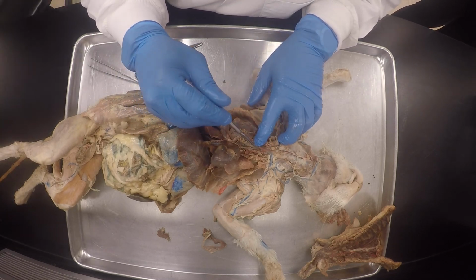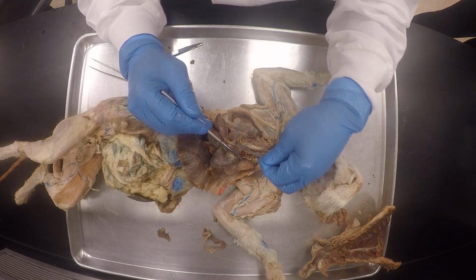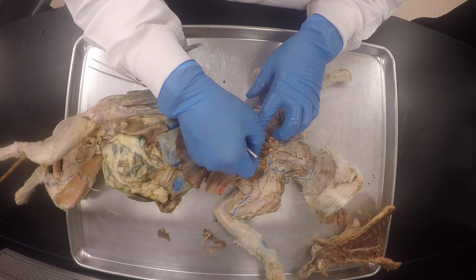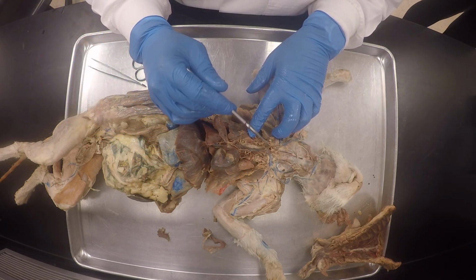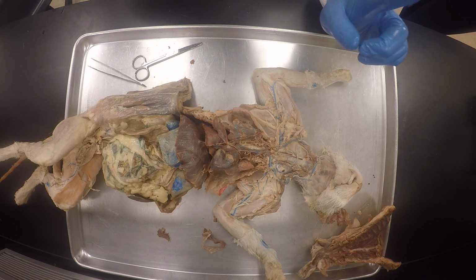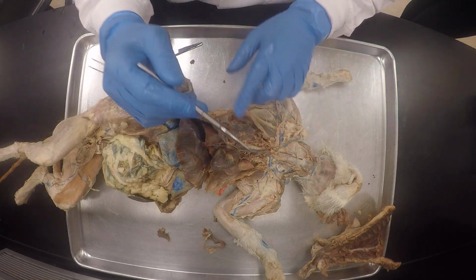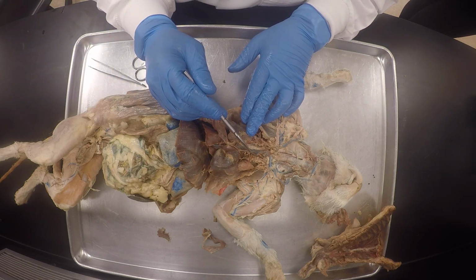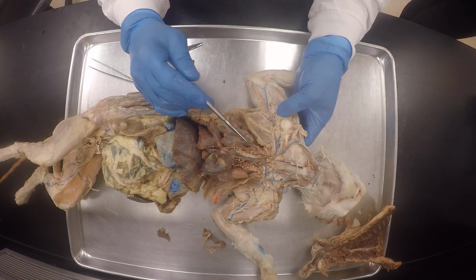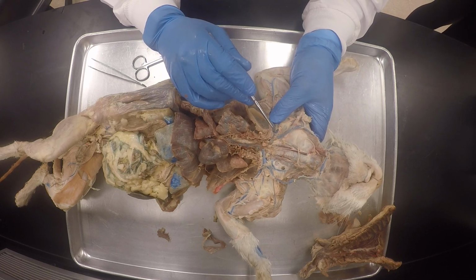The internal mammary could be somewhere here, my good friends. I apologize. So the internal mammary would have been here. There's only a small stump. You see this configuration, it was really torn off when we were doing it, but you see, sometimes it comes off as one, then it branches like this. Instead of coming like the first time I drew it, coming off as one branch that splits to supply the breast. Okay, so internal mammary vein is this, and then azygos vein is this, superior vena cava, inferior vena cava, and here, this subscapular vein kind of branched too early, you know what I'm saying?